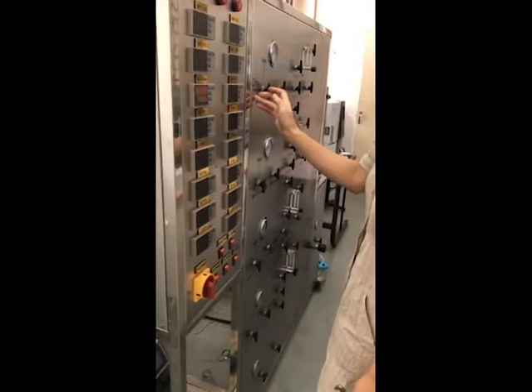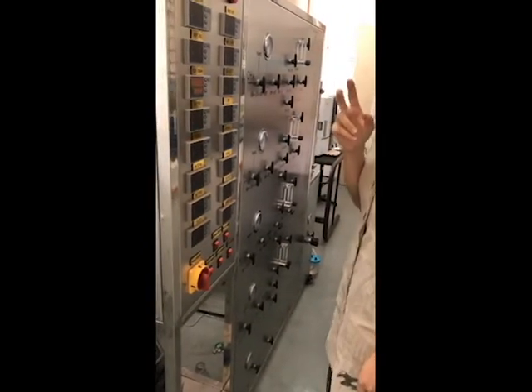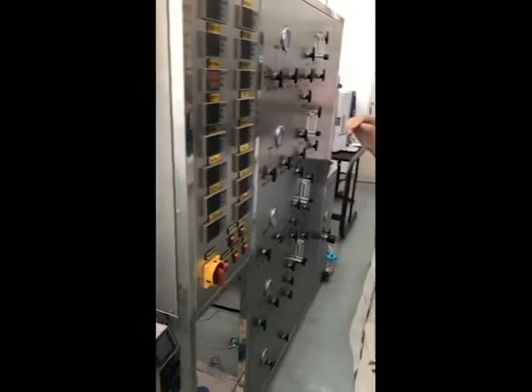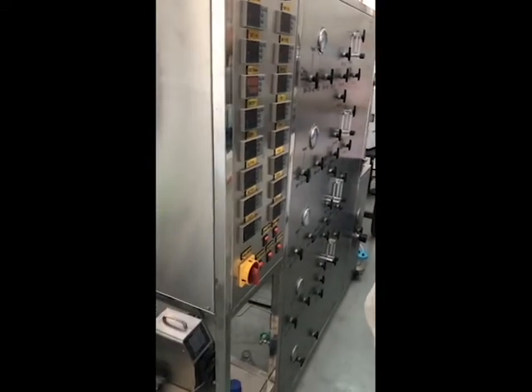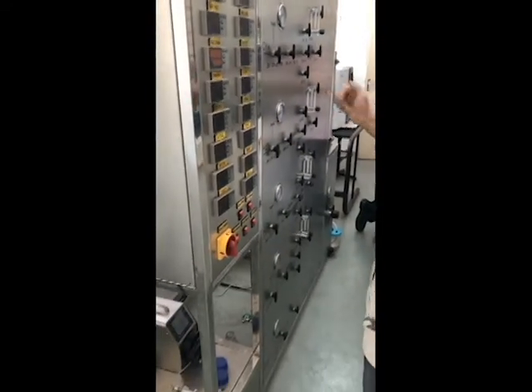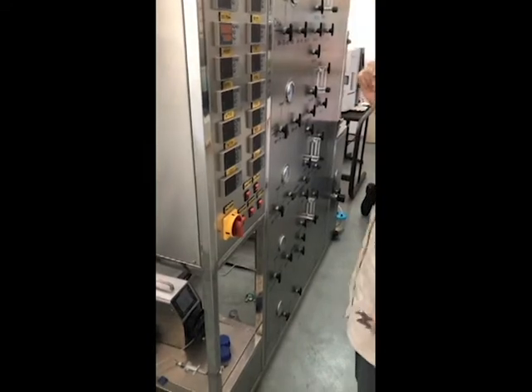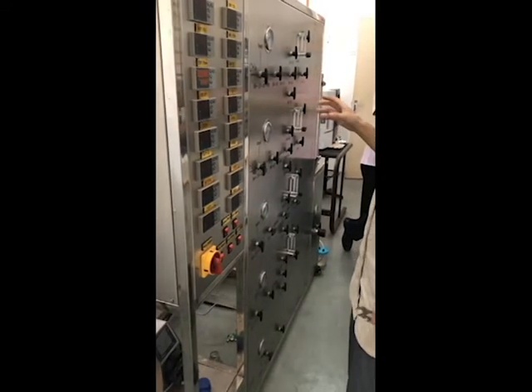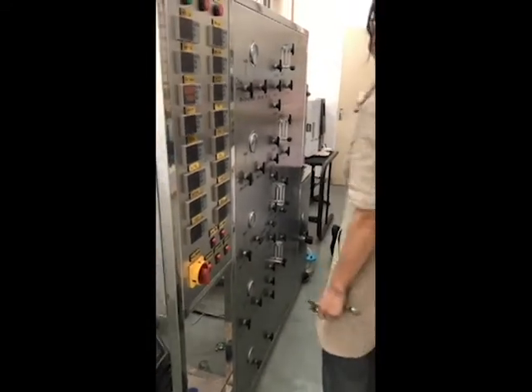So when you are doing your reaction, there are two ways to protect yourself. First is to turn on the exhaust fan. Both methane and hydrogen have density lower than air, so they go upper. Then we install the exhaust fan at the upper. So turn on the exhaust fan before you start, to protect yourself.